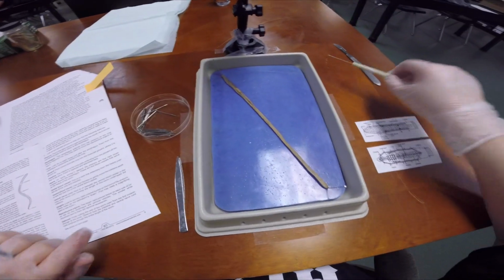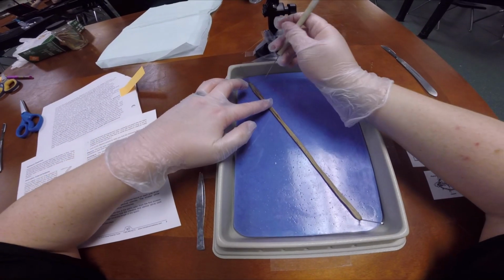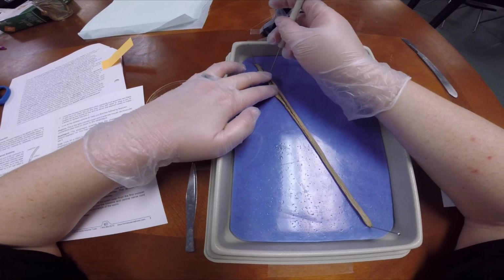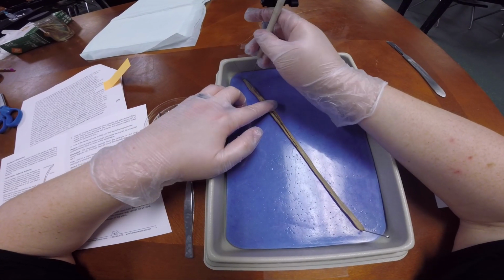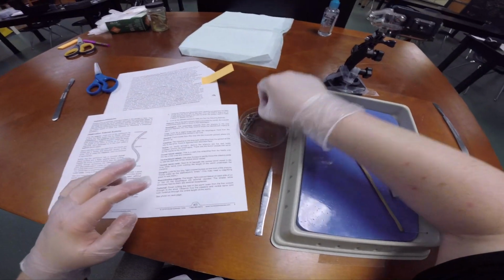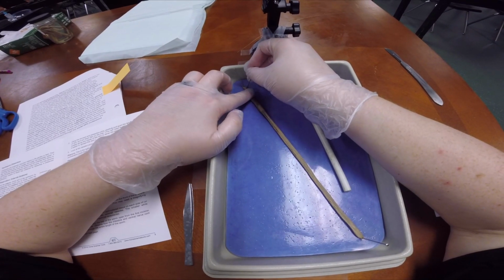All right, then we can take our poker and see how well we did up here. Let's open him up a little bit. Oh, I accidentally cut through him. That's okay. You'll notice that this part between the clitellum and the mouth is a little bit more difficult to get open. So we are going to take our pins and pin this guy to where you can see him better, maybe.